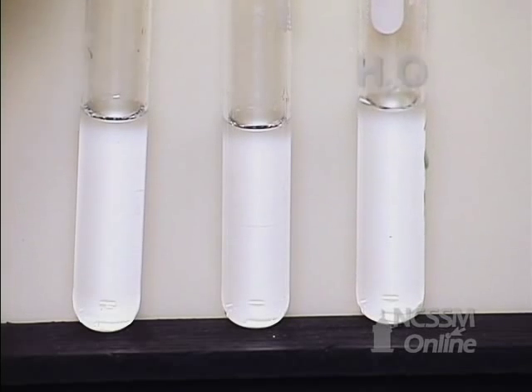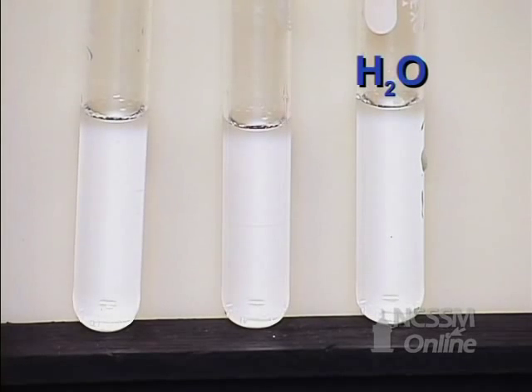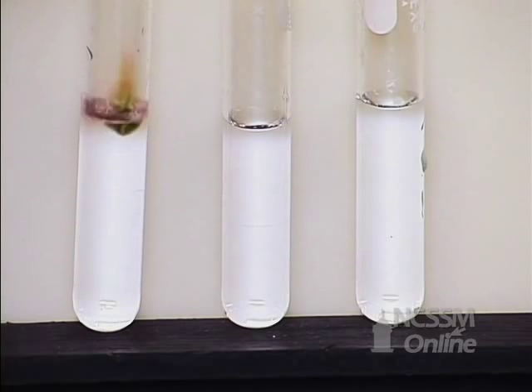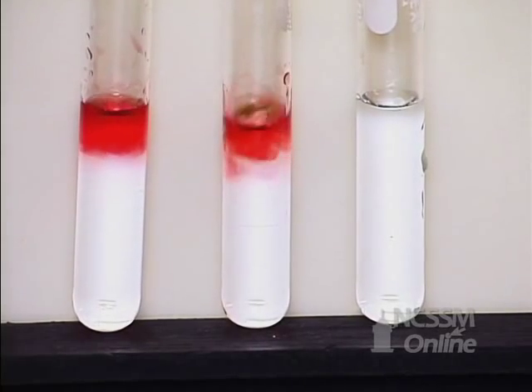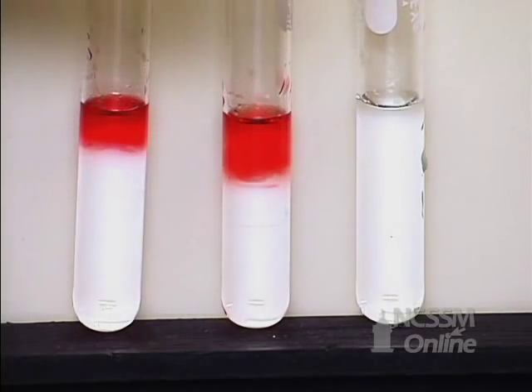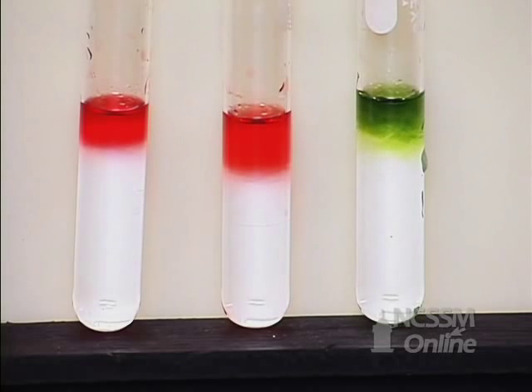And in the third test tube, I'm going to put just deionized water, same amount. To each of the three test tubes, I'm going to add some universal indicator. We'll need to stir these a bit.